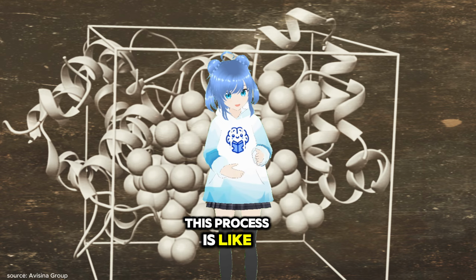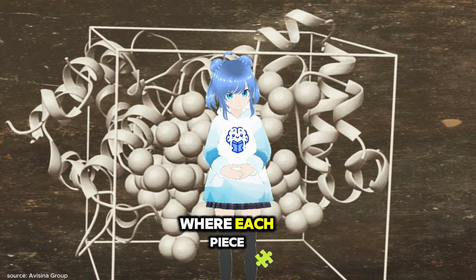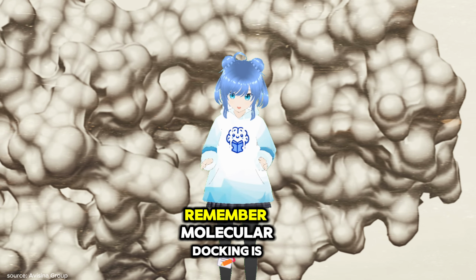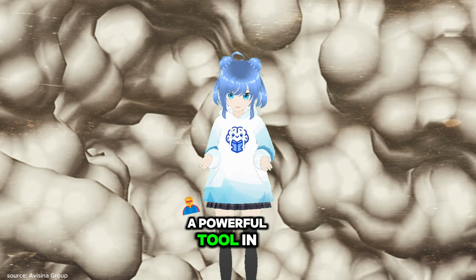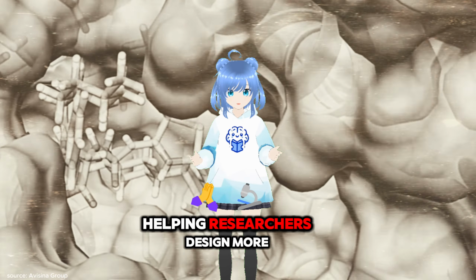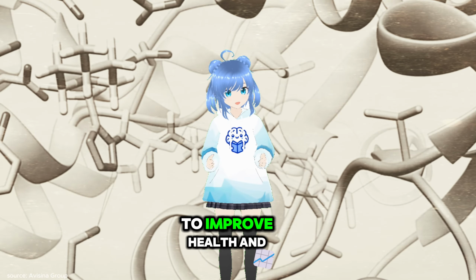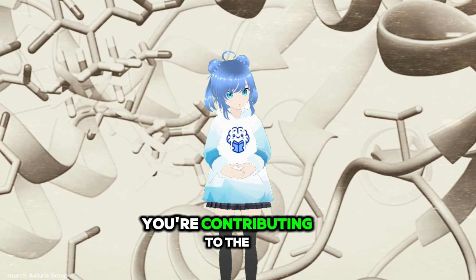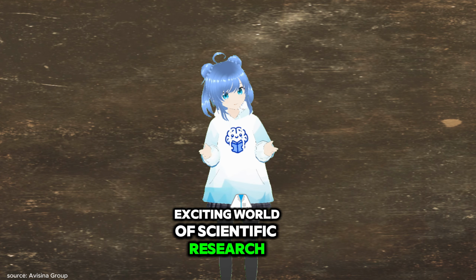This process is like solving a complex puzzle, where each piece provides insight into how drugs interact with their targets. Remember, molecular docking is a powerful tool in drug discovery, helping researchers design more effective medicines to improve health and treat diseases. By following these steps, you're contributing to the exciting world of scientific research and innovation.